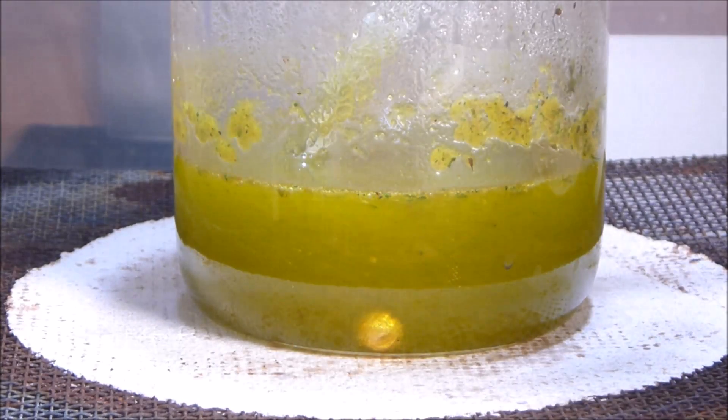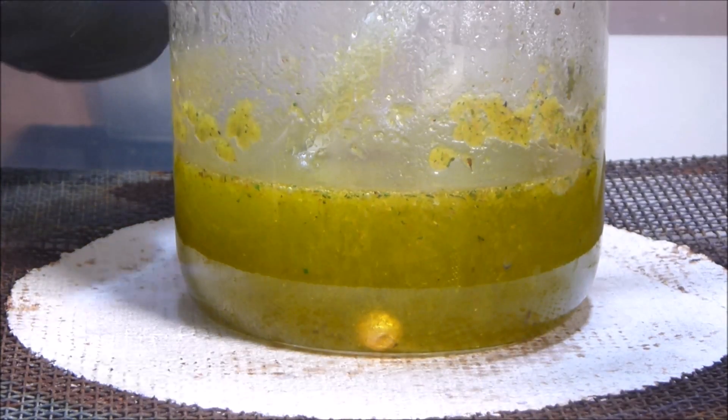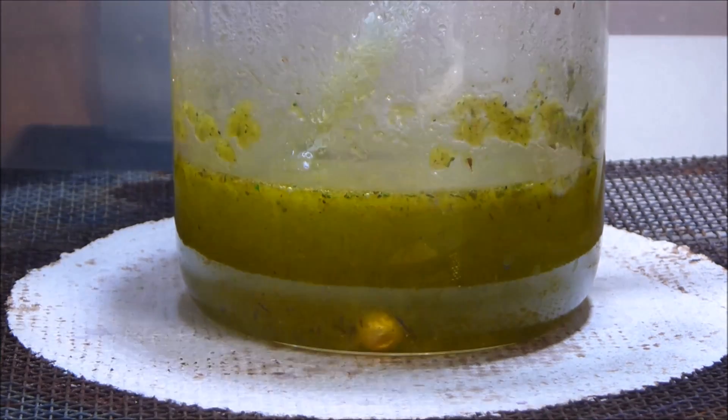Turn the temperature off completely. You don't really want to boil your solution because it can boil gold out of solution, but also it's really hard to tell the difference between bubbles created by the reaction with the gold button versus the boiling. At the moment you can see at the bottom I am boiling this.